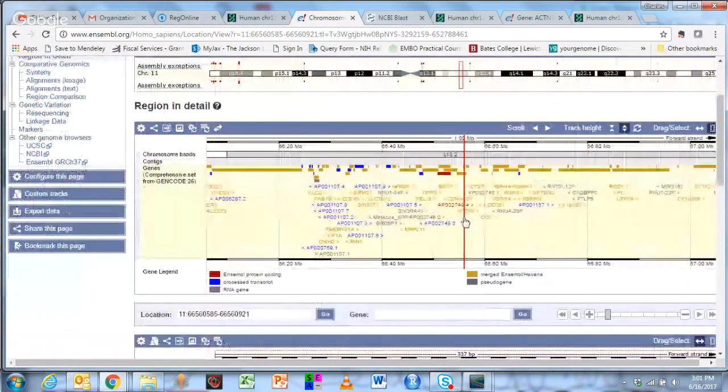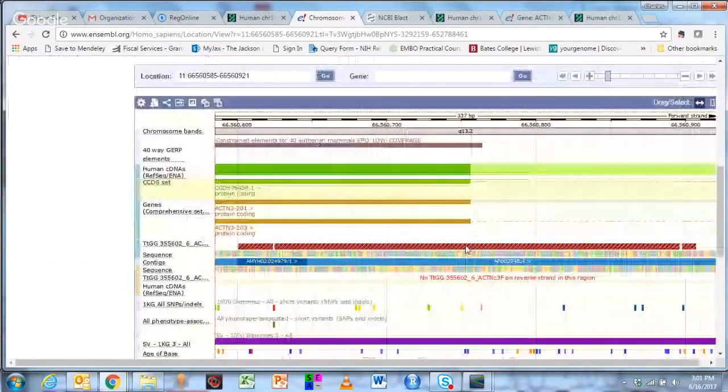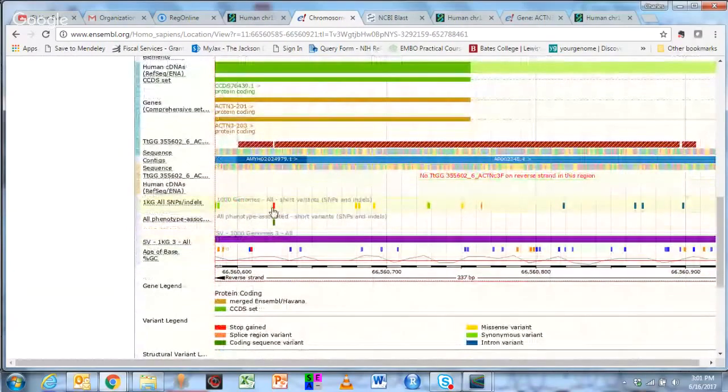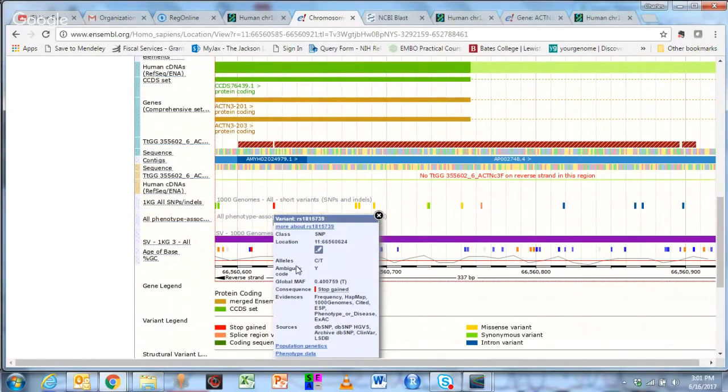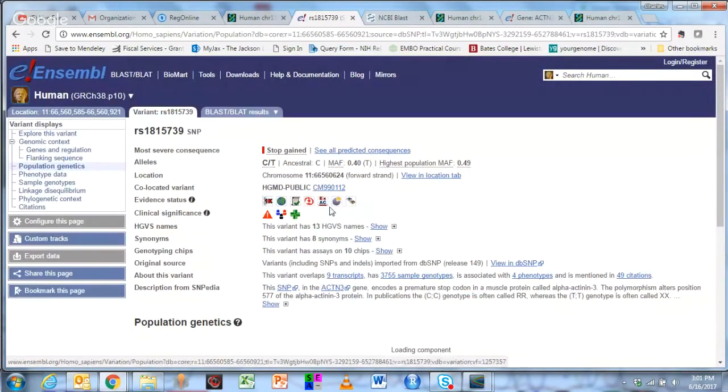And this is just putting the same kind of style here, showing exactly where we were. Here's actinin 3. And here's the DNA sequence that we generated. You can see it says TtGG, so let's put it in the context. And these, again, are the SNPs. You can mouse over these and highlight them, and it'll tell you what the SNP is. The alleles are C and T. It's a stop gained. You can look at population genetics, which is nice from here, which is a different view than the frequency view we saw before. See if it'll work. There we go.